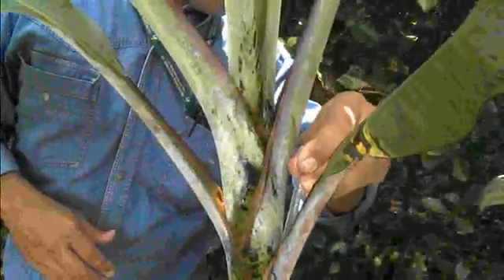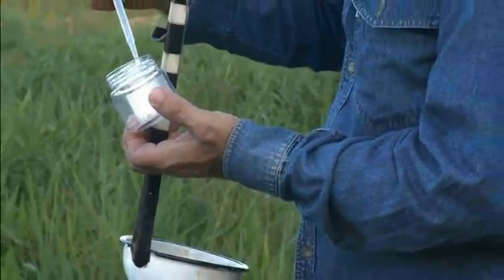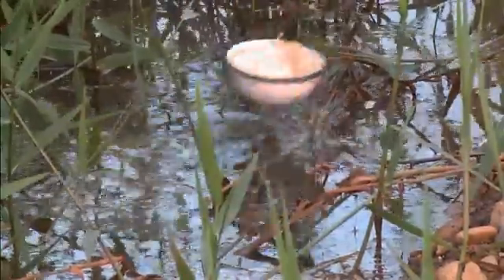You have now seen an overview of the general techniques used to capture mosquito larvae and pupae. As with any methodology, practice is needed to improve technique and develop a reliable collection methodology.